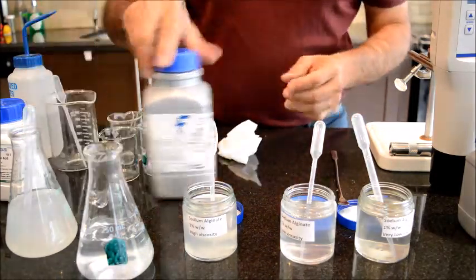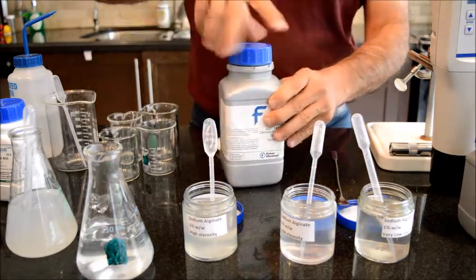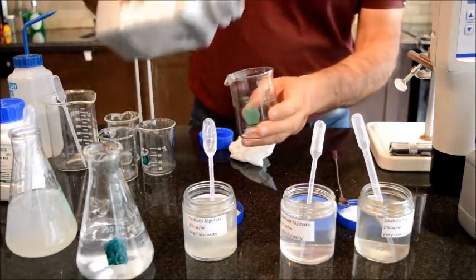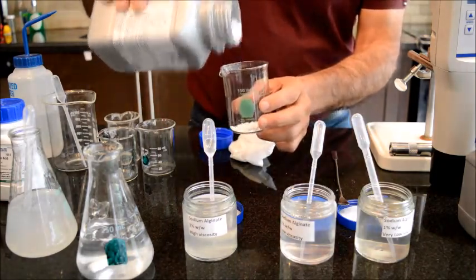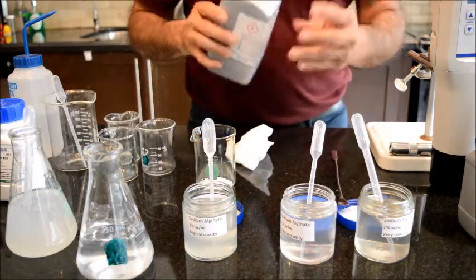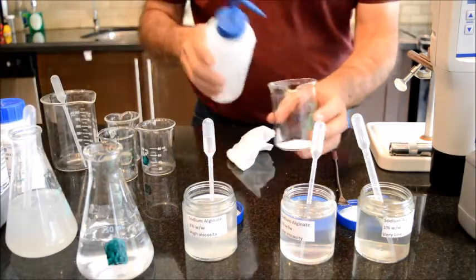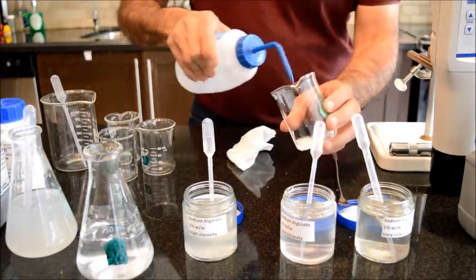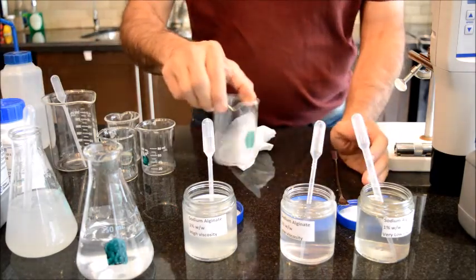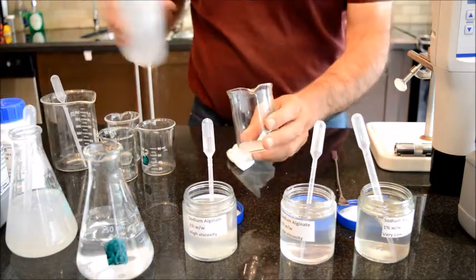Before I go to the analytical aspect, I would like to do a little bit of fun chemistry, which is adding calcium chloride to alginic acid. In theory, you have to have a 1:1% ratio to have this special effect. But I'm not measuring it, I just added a little bit by hand. I tried to dissolve the calcium chloride and make a rather concentrated solution.